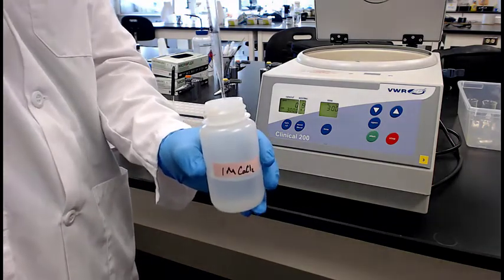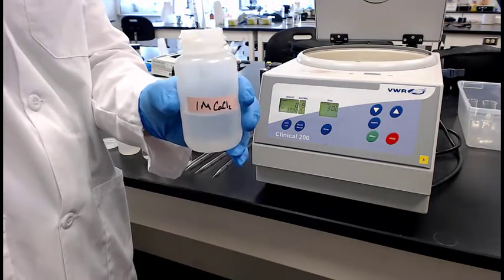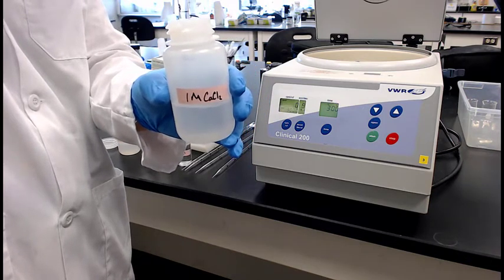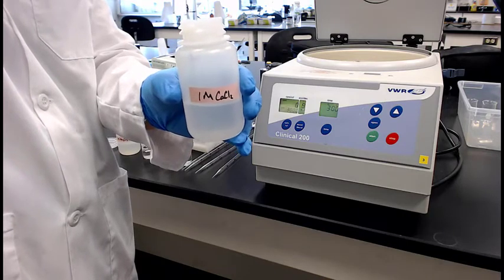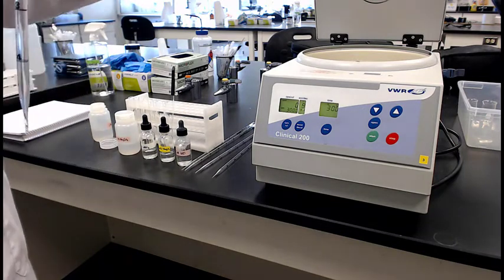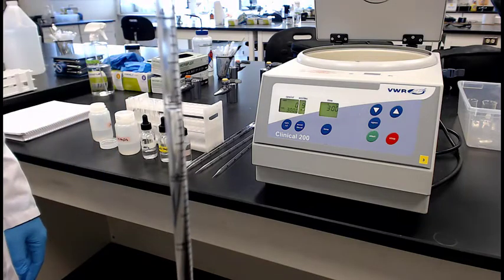And again, this is what we call qualitative work. It doesn't have to be exact. But if you pull up 3 mL and dispense it all the way out, that's going to be good for this. It would not be the way you'd do it if you're making a calibration curve, because you'd want to rinse your volumetric pipette and go line to line on your measurements.